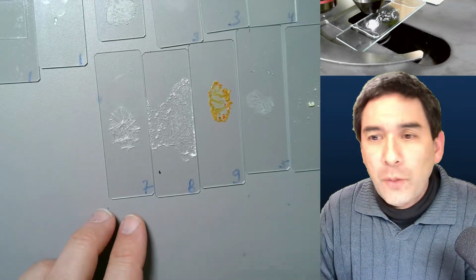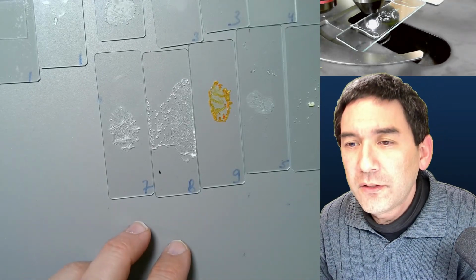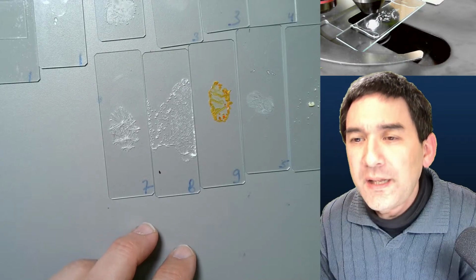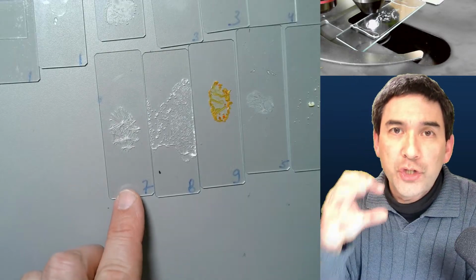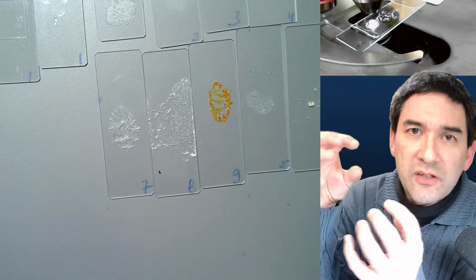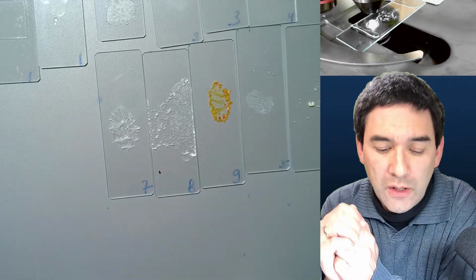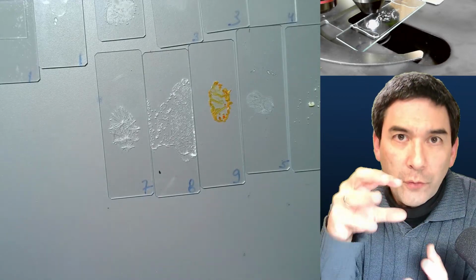But I would say let's go back a little bit to the crystals and have another look at those. So why do crystals form in the first place? Well, crystals form because the substances have a certain shape, and when the liquid evaporates, when the water evaporates, then they cannot be held in solution anymore, and they start to stick together in a very organized way. Therefore they will then start to form solids.